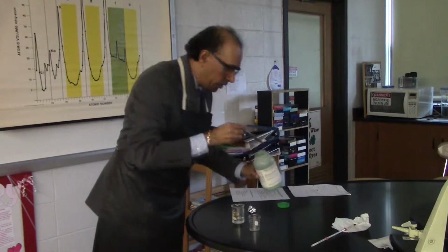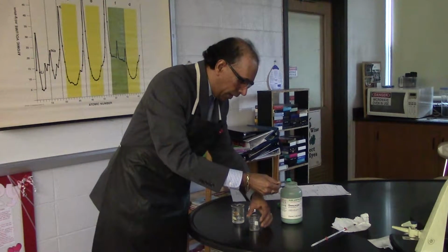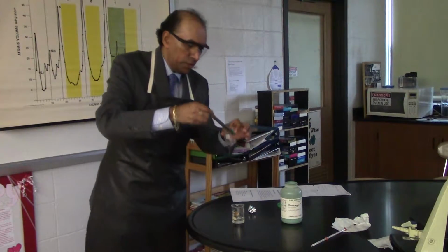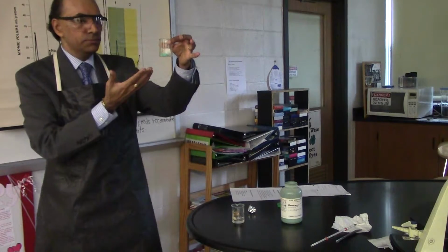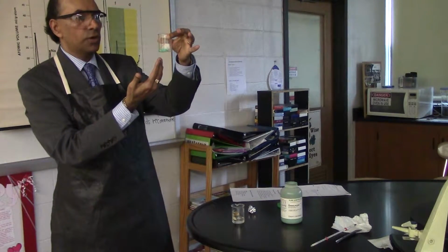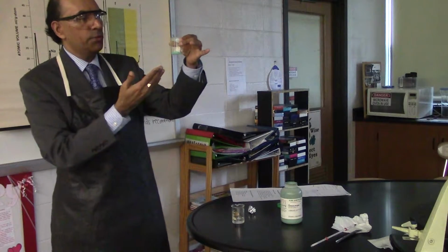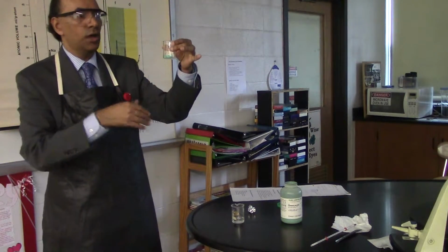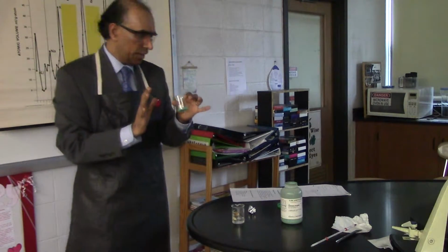All right, so the first step is to put some copper 2 chloride dihydrate inside of the dry beaker and ask students to study the system, which is the dry copper 2 chloride dihydrate, and write down 3 observations. Like, for example, the substance has blue color, you have crystals, etc. All right, so that's your first step.